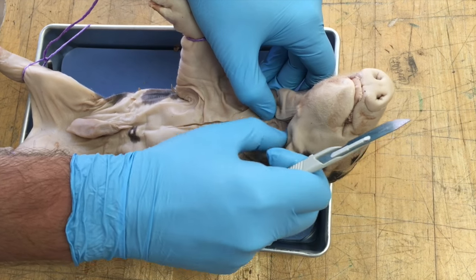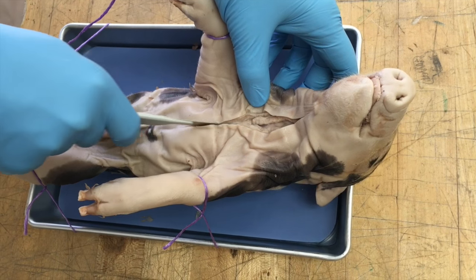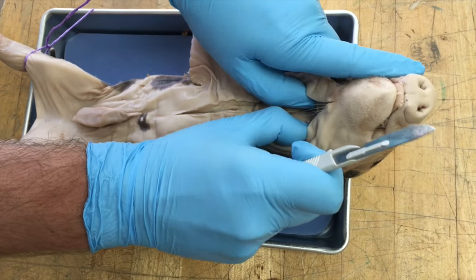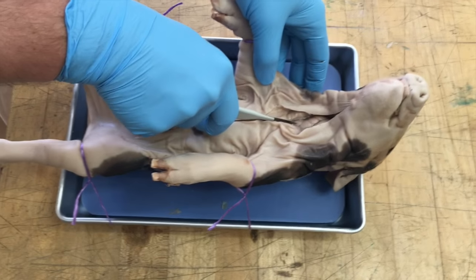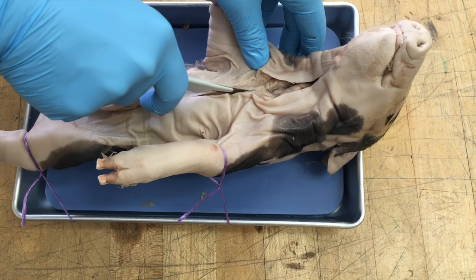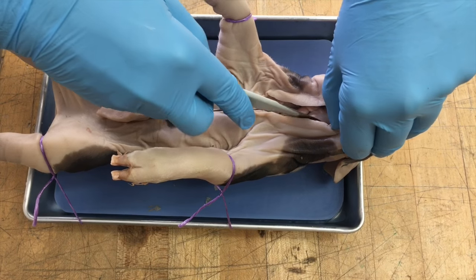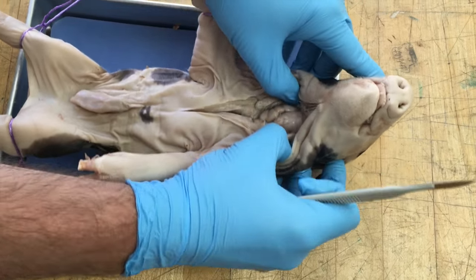You can see I'm able to spread the tissue away. I need to go a little bit deeper, and I'm going to move it with my hands and spread out the structures I want to see. There is a breast bone right here that's going to be a little harder to get through, so you might have to press down a little bit harder there. But for the most part, we can see what we need to see right here.